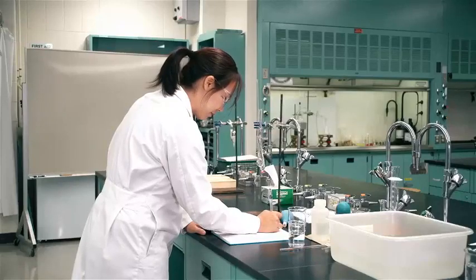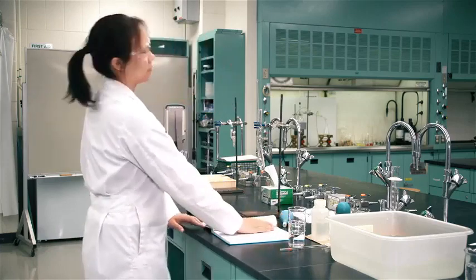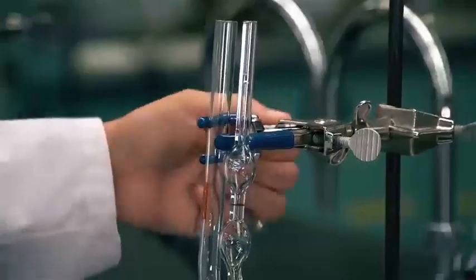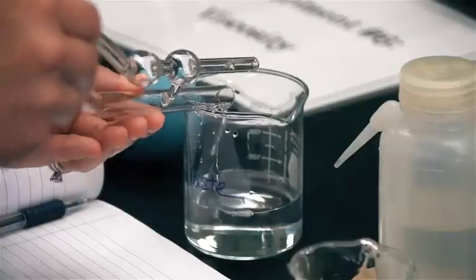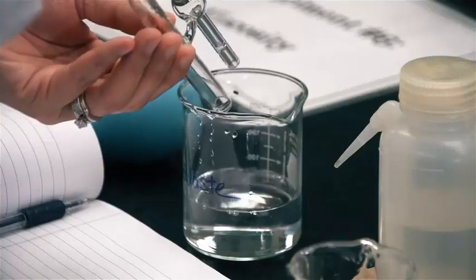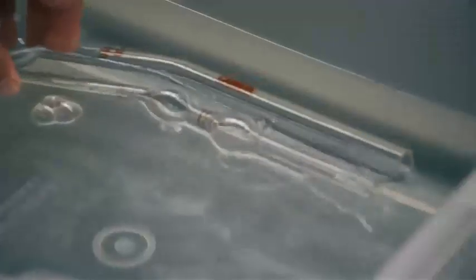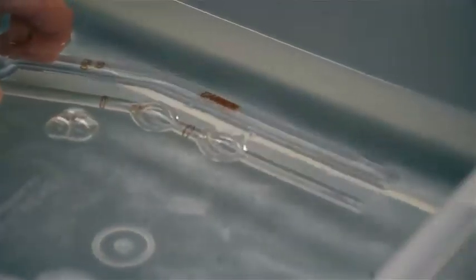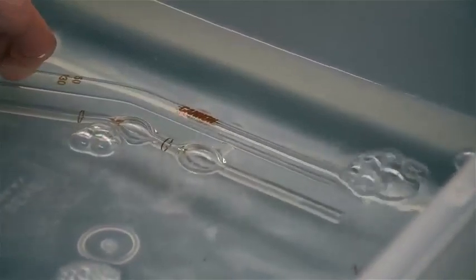For the same sample, obtain 2 flow time readings that are in agreement to within 2 seconds. Dispose of the sample into the appropriate waste container. Always rinse the viscometer with the solution whose flow time will be measured next. Remember to determine the flow time of the reference liquid. Put the viscometer into the cleaning bath at the end of the experiment. Make sure the soap solution fills the viscometer.